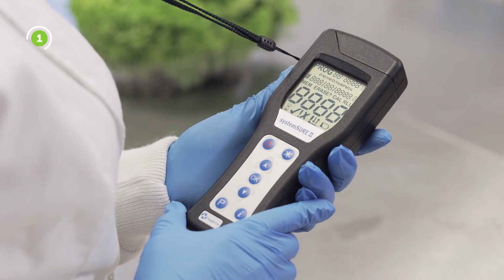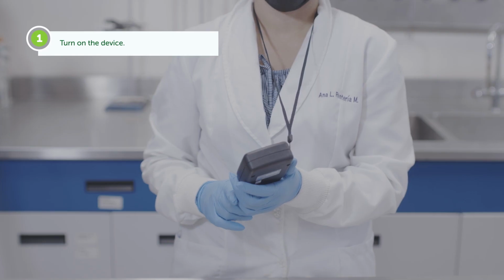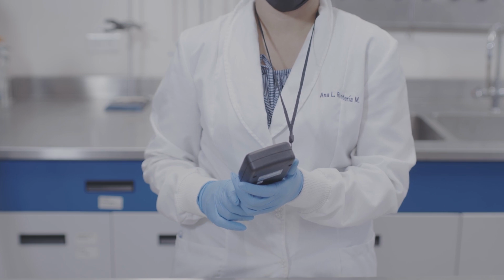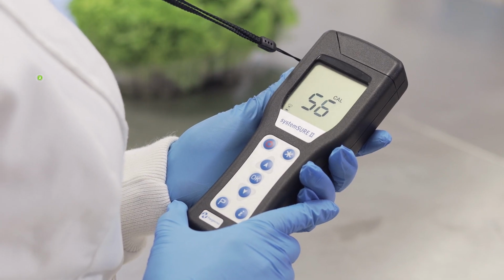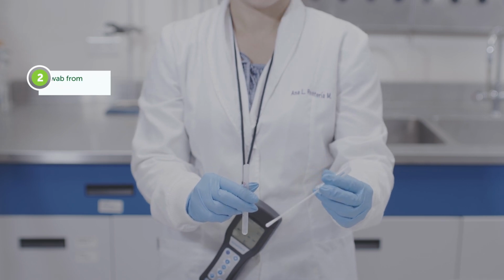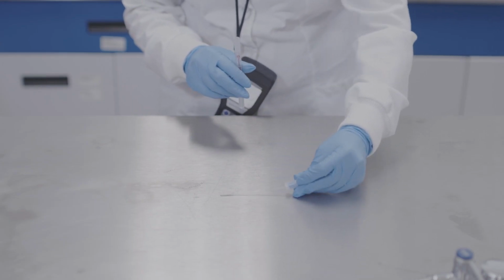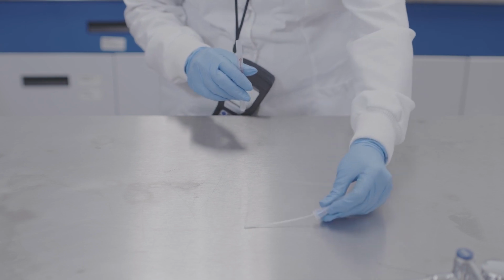Procedure. 1. Turn on the device. Some luminometers need only a few seconds to internally verify its calibration. 2. Remove the pre-moistened swab from the tube. Use a proper swabbing technique, like a crisscross pattern, to cover all the sample area.